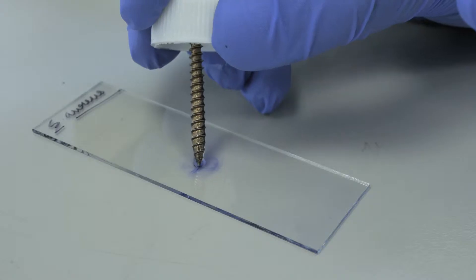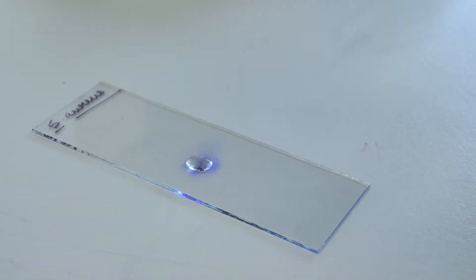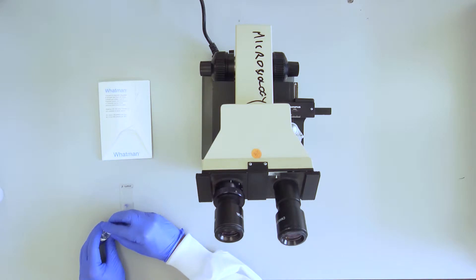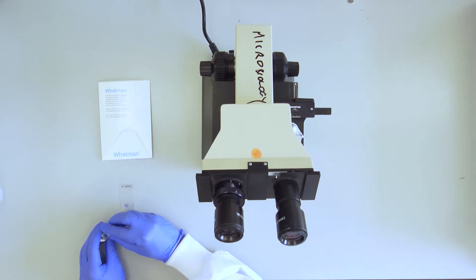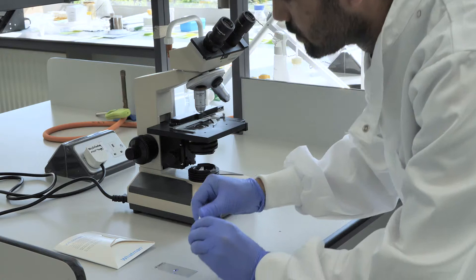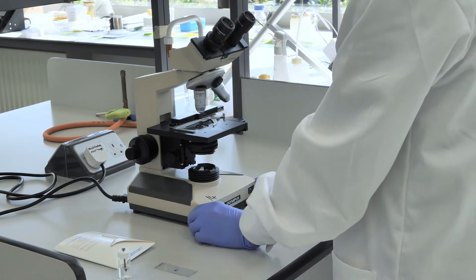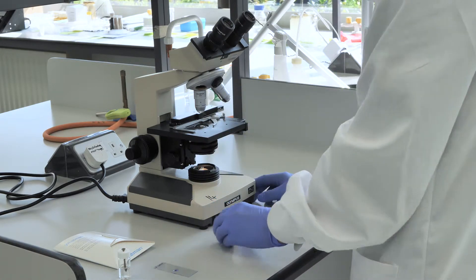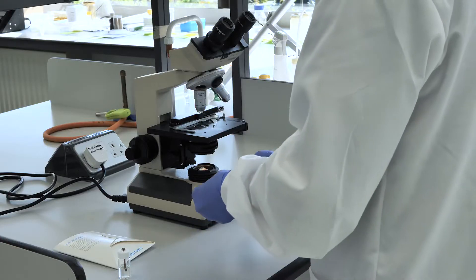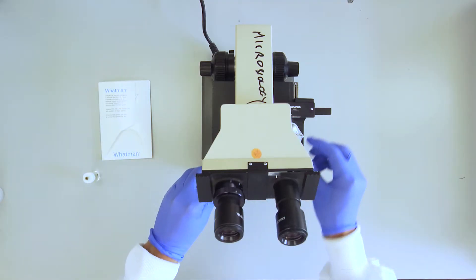Place a drop of oil on the sample that has already been prepared on the slide. Turn on the microscope. Place the slide on the microscope stage.